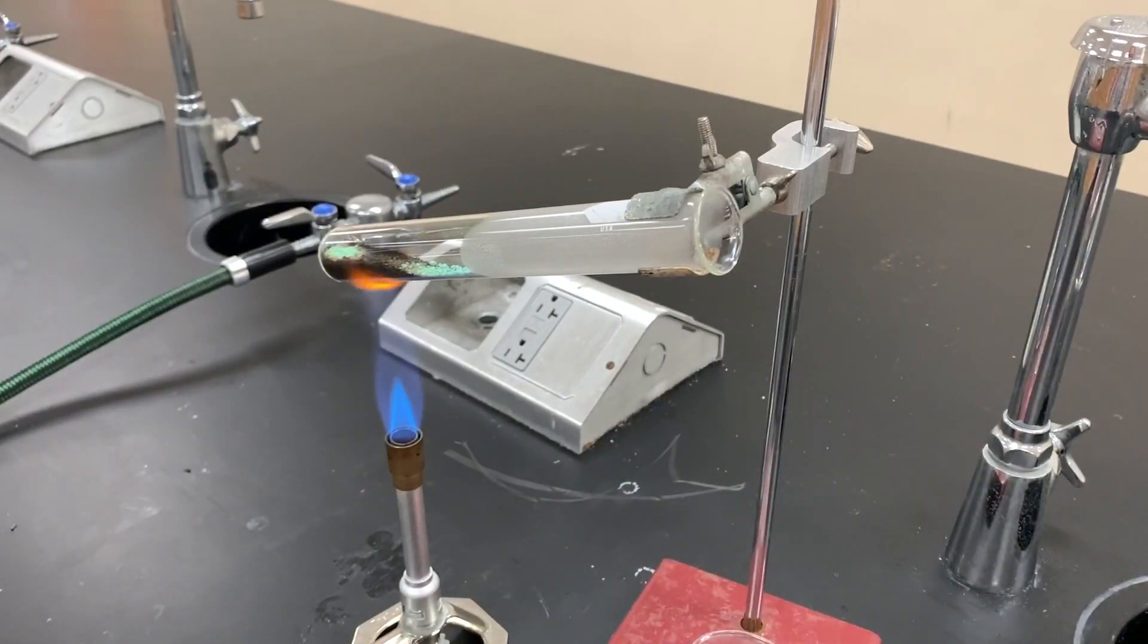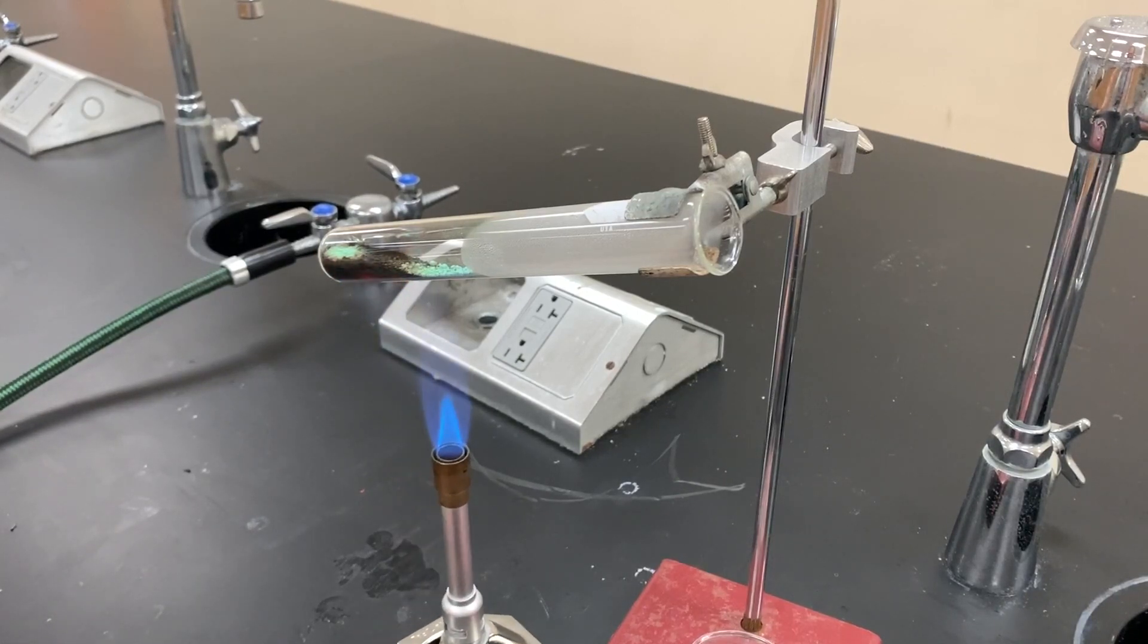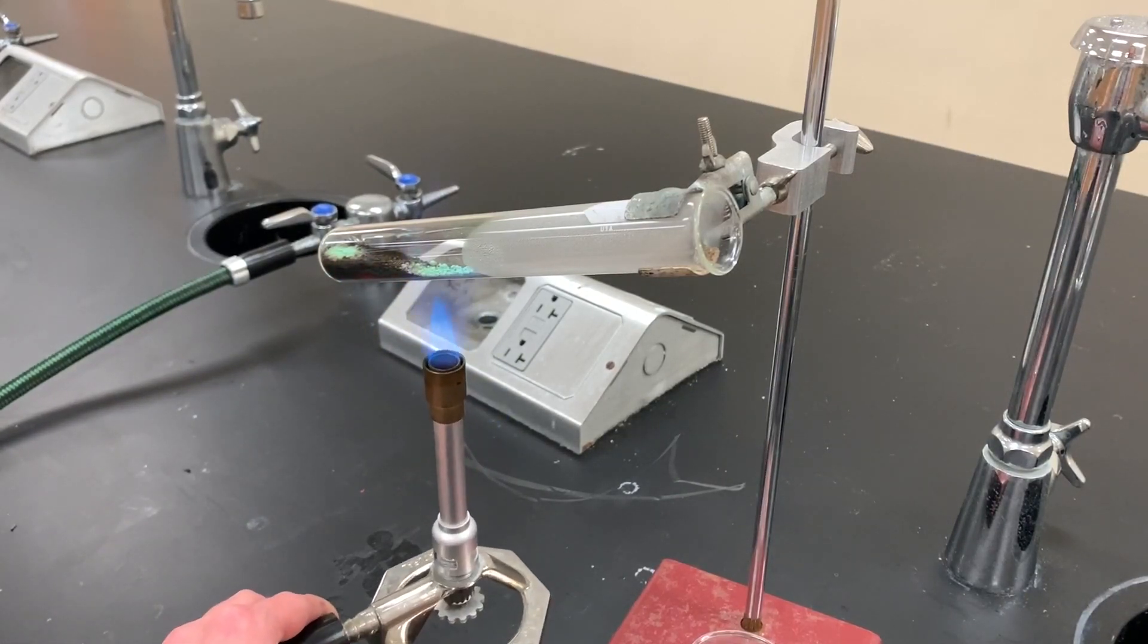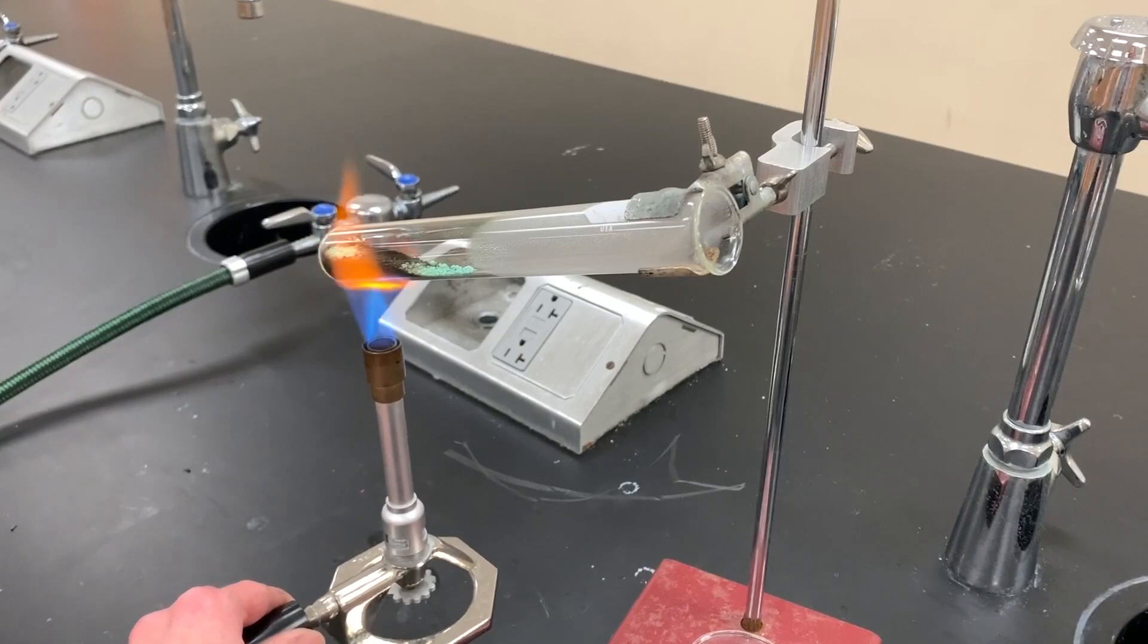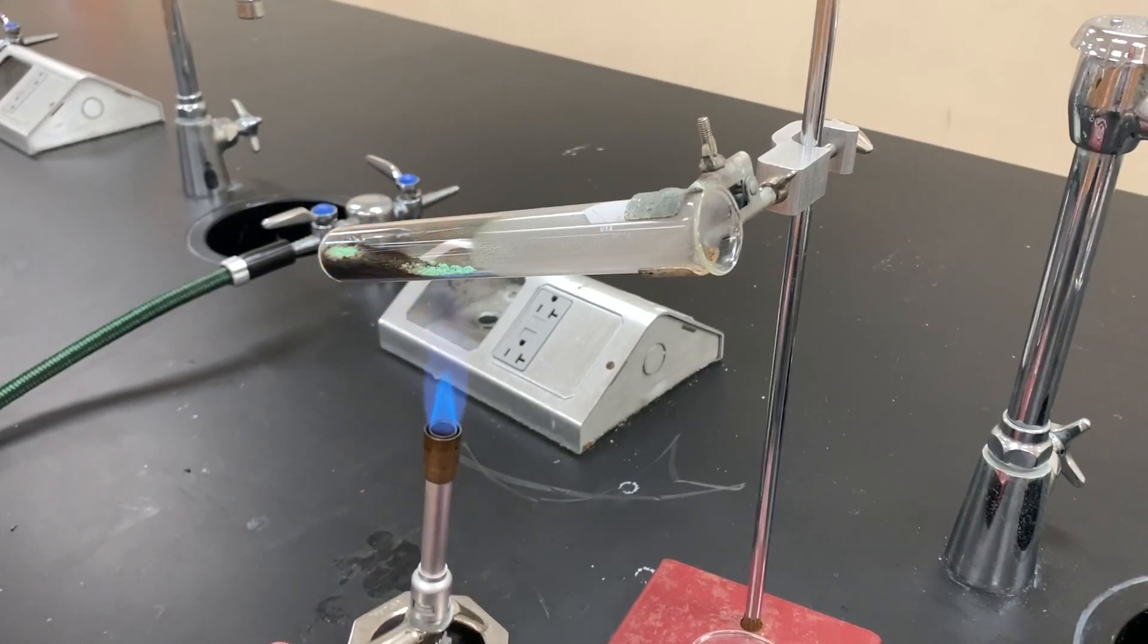I'm going to keep heating this and I'll show you what it looks like when I'm done. Here is the finished product. My copper two carbonate looks to be completely decomposed into copper two oxide.